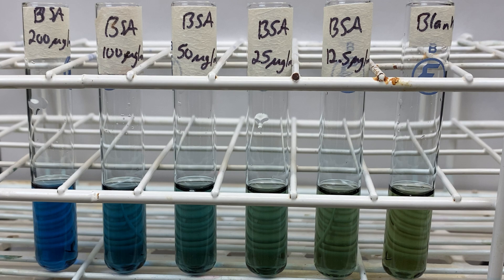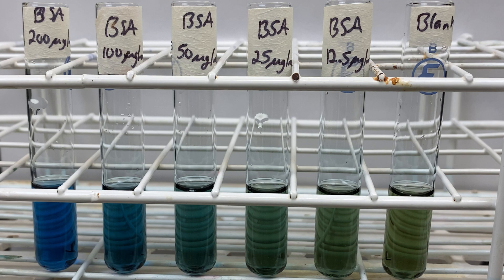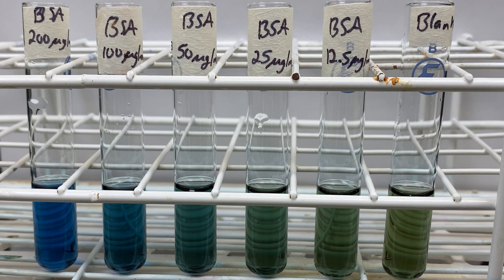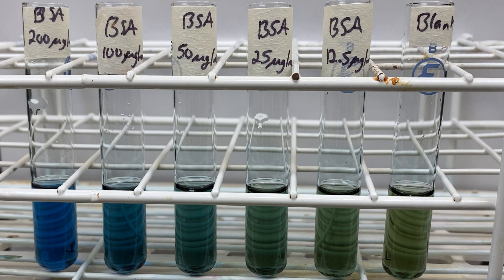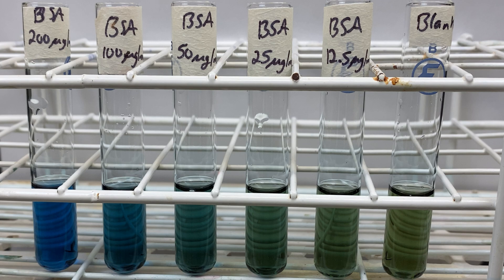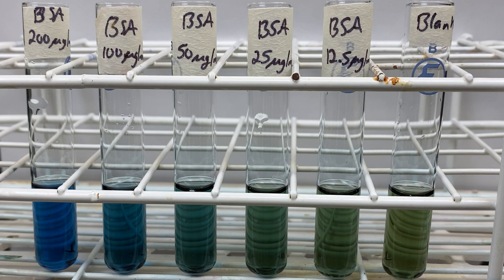We do this using a standard curve. I have a number of known concentrations. I will analyze each of these in the spectrophotometer to determine what the absorbance was. I can then graph the absorbance compared to the concentration, and this will be my standard curve. The standards are my known concentrations. Any unknown sample that has a concentration within the range of my standards, I can compare the absorbance of this unknown to my standard curve. With this technique, I can quickly and accurately determine the concentration of my unknown sample.